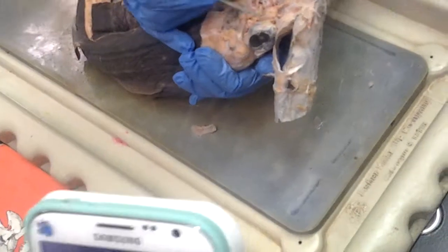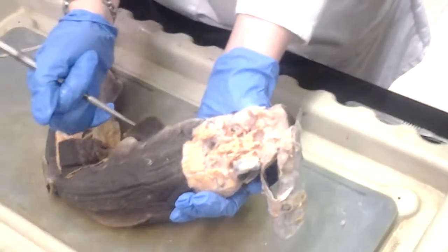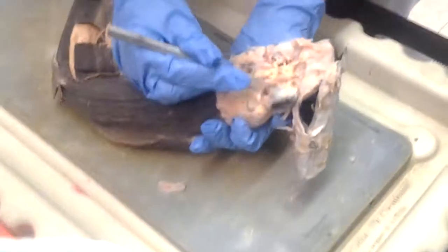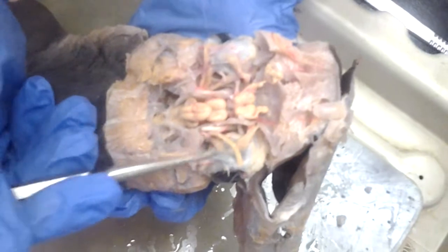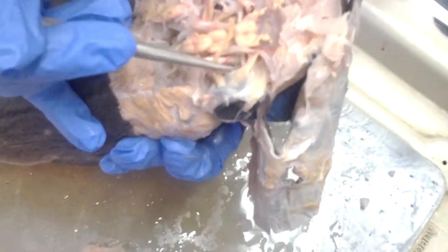For the bottom side, the really flat one is the infraorbital nerve. It's wide and flat. Now this is the optic nerve. See this white thing? The medial rectus, the lateral rectus. This white one is the superficial ophthalmic nerve. And the optic nerve is the white thing that goes directly perpendicular to the body axis.